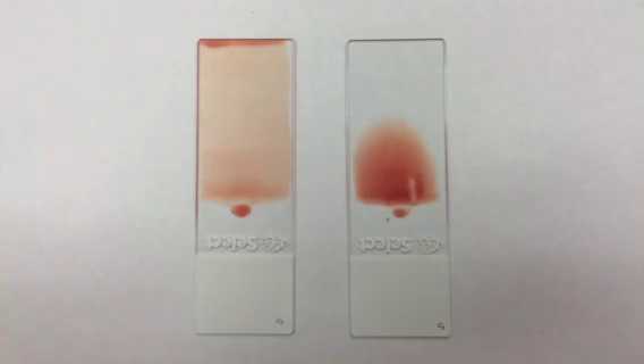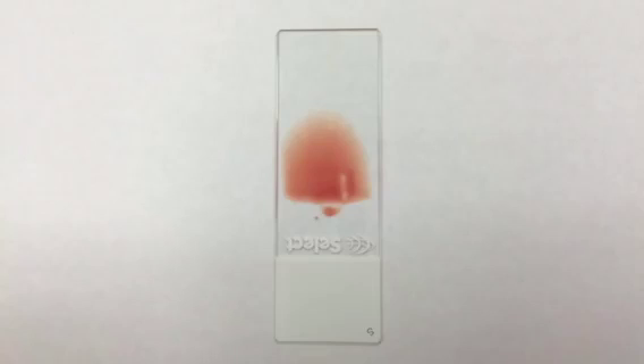The next factor is speed. Can you guess which one was done too slow and which one was done too fast? Yep, you guessed it — this one is done way too slow. Right again, that means this one is done too fast.